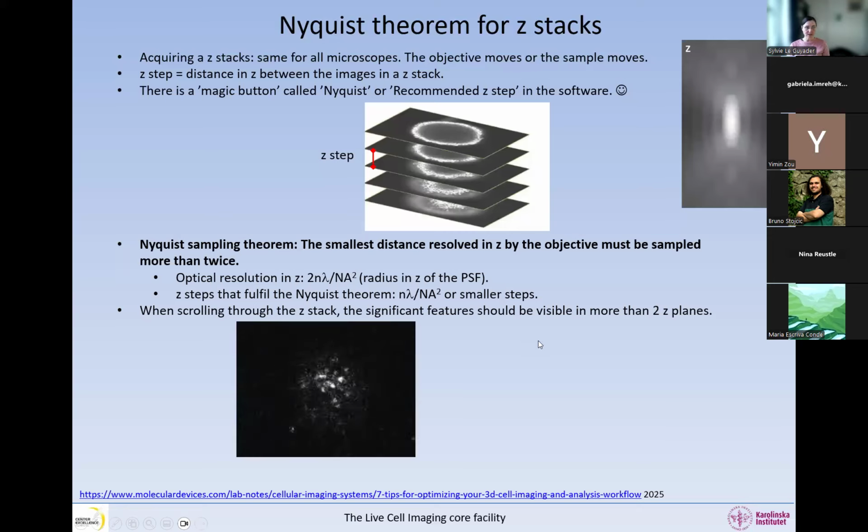So I show you what I mean. Here I have a Z stack which is very highly sampled, so I have small distances between the Z planes. If you focus on one of these dots, you will see that each dot appears in several Z planes. You can see the dot for quite a while as we go from one plane to another, and each dot is represented in more than 2 images in this Z stack. That means I am sampling these dots in the correct way. They must be represented in more than 2 images.